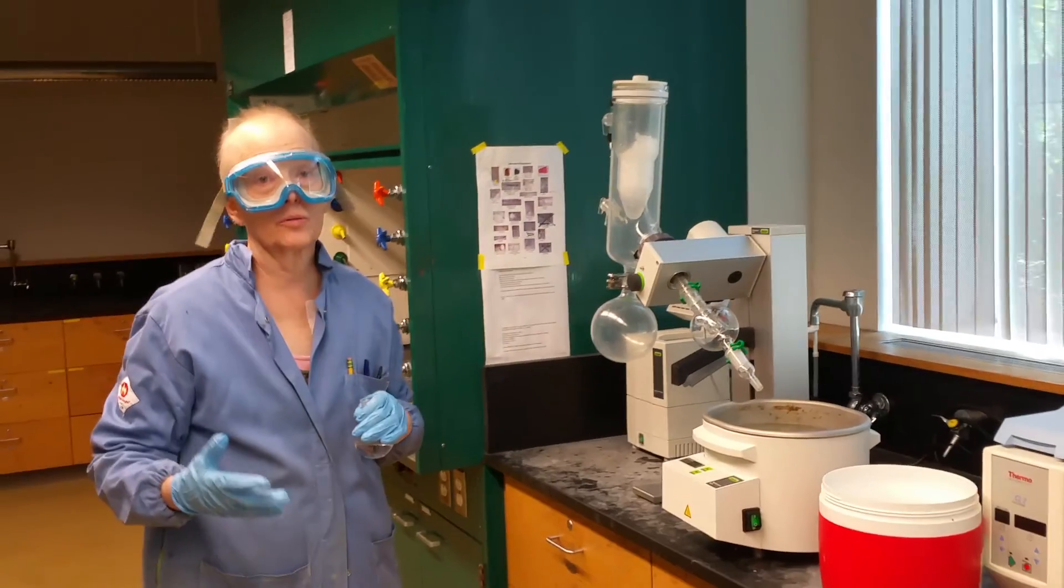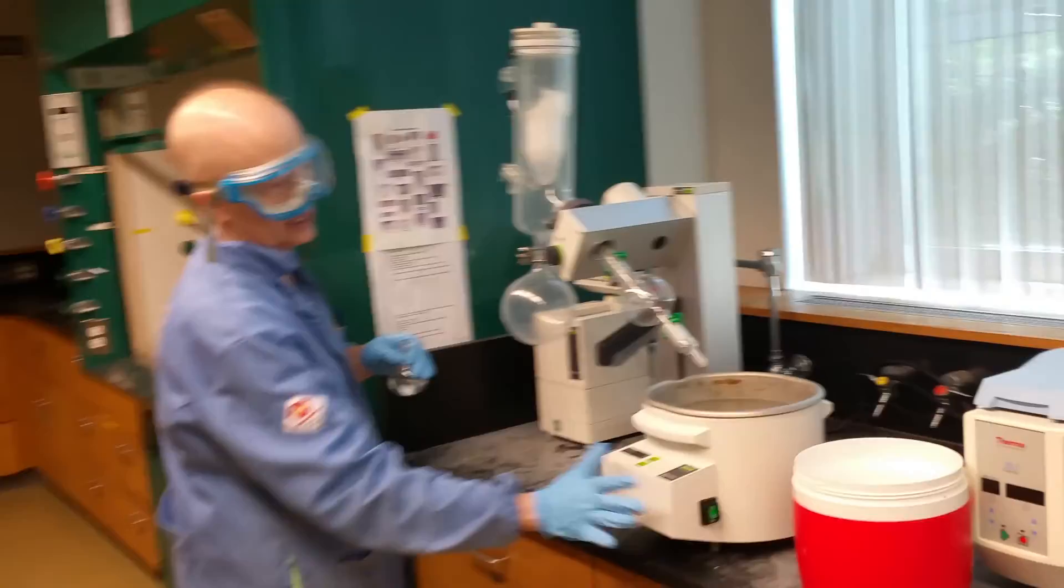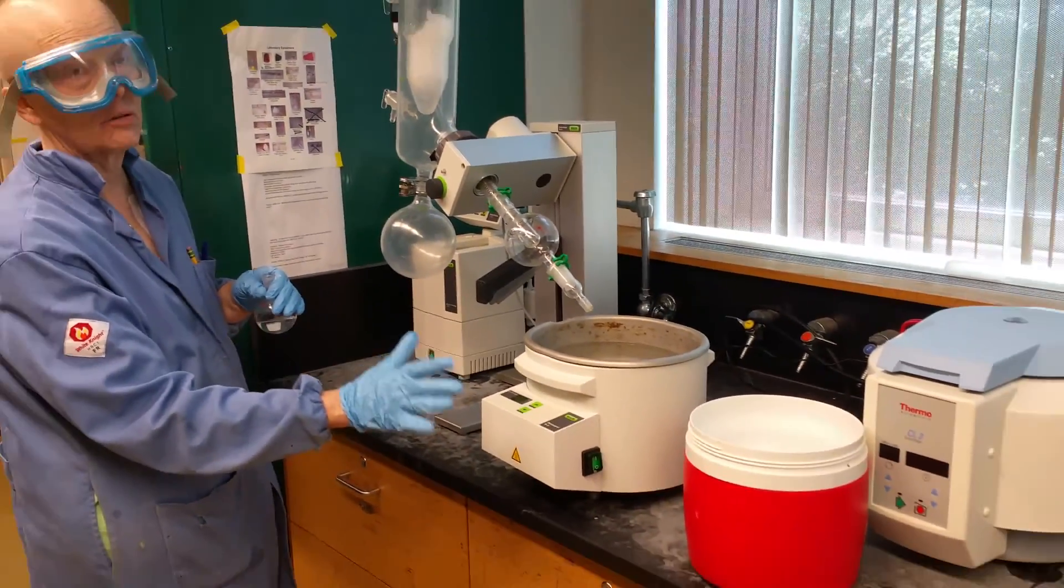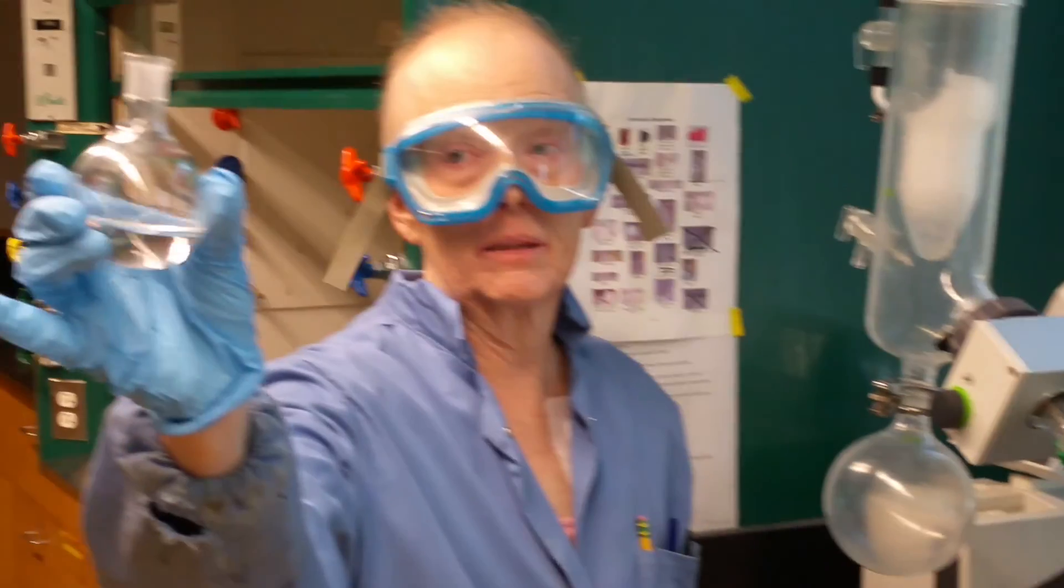This is our kind of new style rotary evaporator. The type of rotary evaporator that's in the first video is what's called a cold water condensed rotary evaporator. This can be used either with ice, I have ice in it right now, or dry ice. So we can go to very low temperatures.